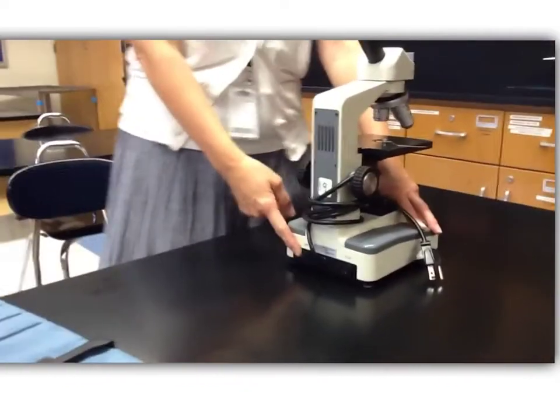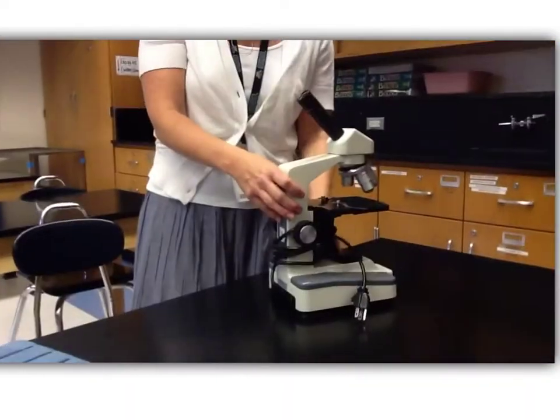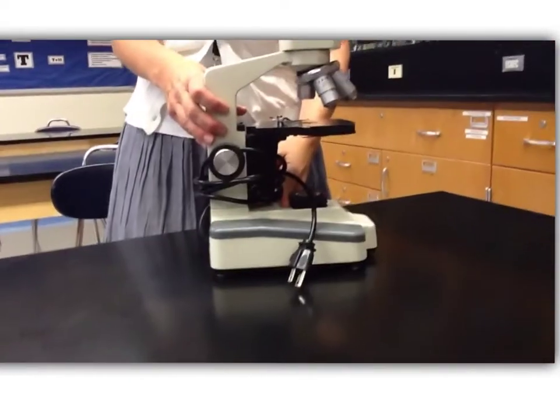Some of our microscopes, if you have the gray microscopes, you're actually going to see it right next to the light source.